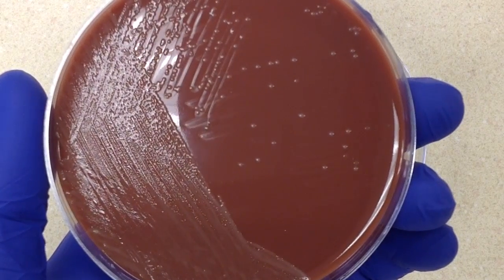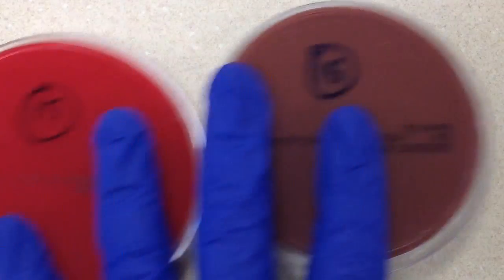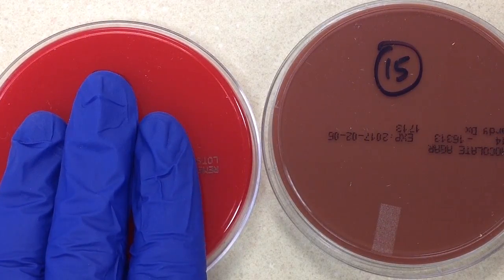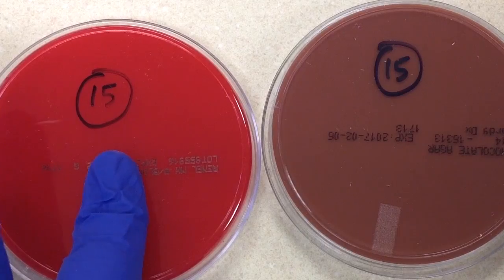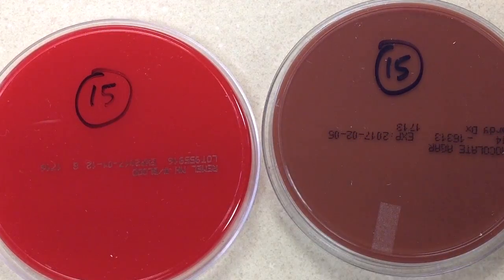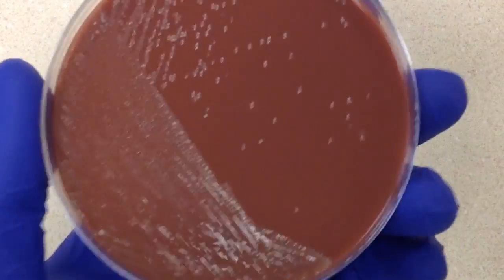We know that Haemophilus influenzae requires X and V factors. X is hemin, and V is nicotinamide adenine dinucleotide (NAD). Sheep blood contains the X factor extracellularly, but the V factor is intracellular. That's why when we boil sheep blood we get chocolate agar — it releases the NAD, or V factor. For that reason, Haemophilus is able to grow on chocolate but not on sheep blood.